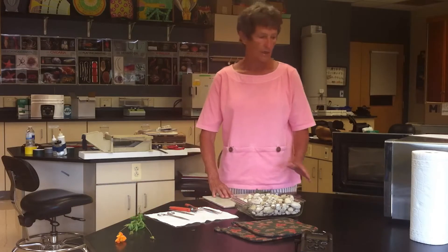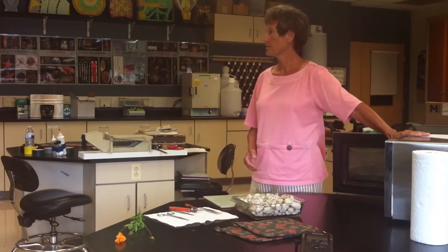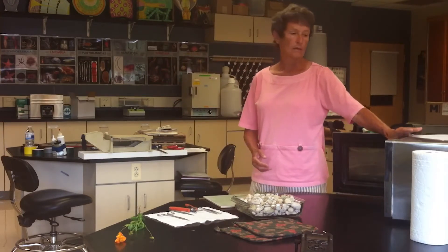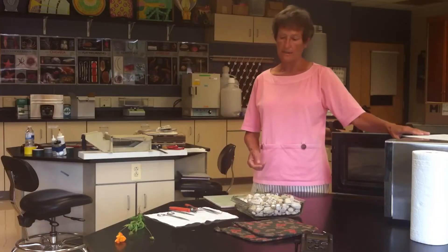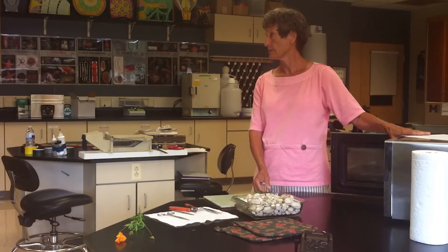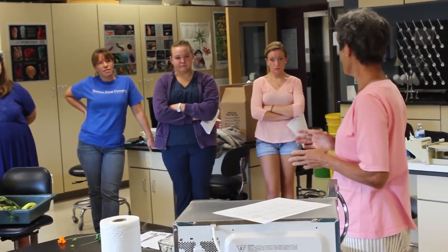This is a microwave technique. The microwave technique has some advantages over the traditional air drying technique. One of the biggest advantages is that it is fast and easy — it only takes a couple minutes to dry a plant. Another advantage is that many people claim microwaving preserves the color of the specimen better than air drying. A third advantage is that microwaves kill bugs; if people put plants in a press, sometimes they come back days later to find a creature has eaten holes in it. You won't have that problem using a microwave.